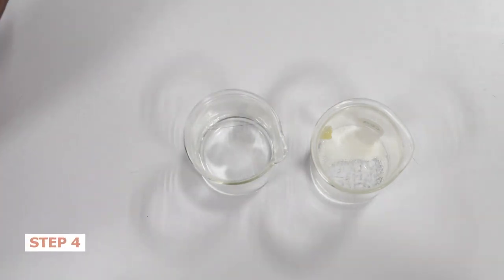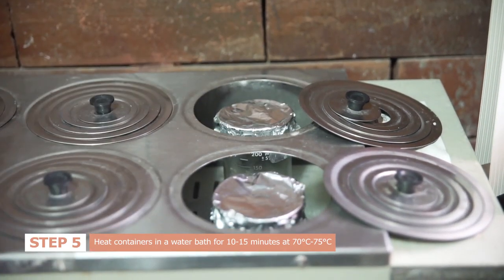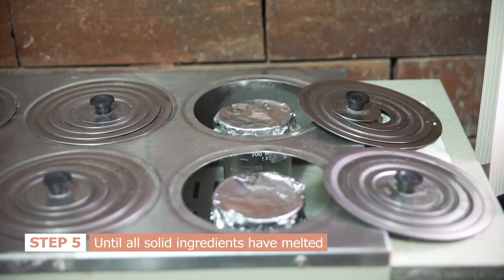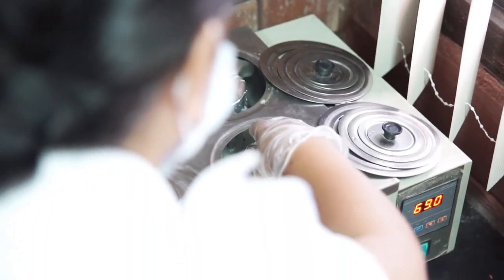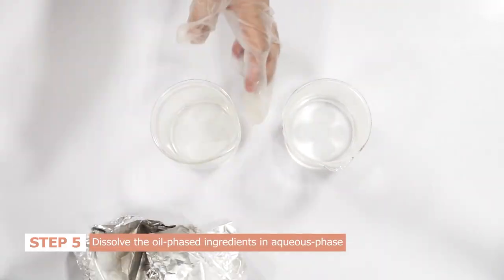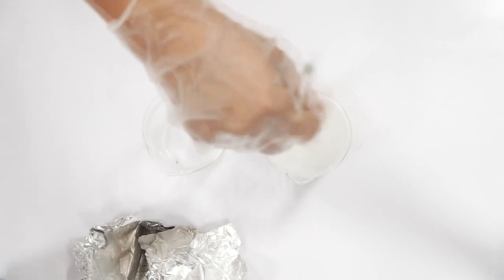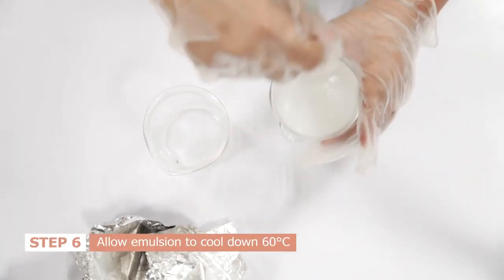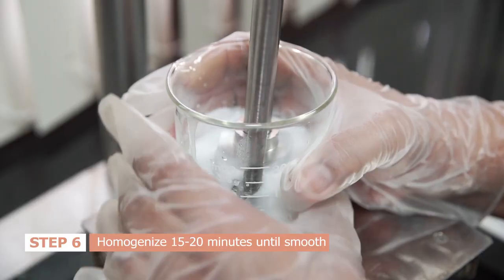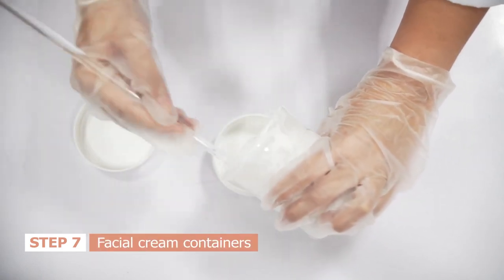Cover both containers with aluminum foil. Heat both containers in a water bath for 10 to 15 minutes at 70 to 75 degrees Celsius until all ingredients have melted. Once done, add the melted oil phase ingredients to the heated aqueous phase ingredient while stirring continuously until an emulsion is formed. Allow the emulsion or the mixture to cool down to 60 degrees Celsius and homogenize for 15 to 20 minutes until smooth texture is attained. Use a stirring rod to transfer the mixture to your facial cream containers.